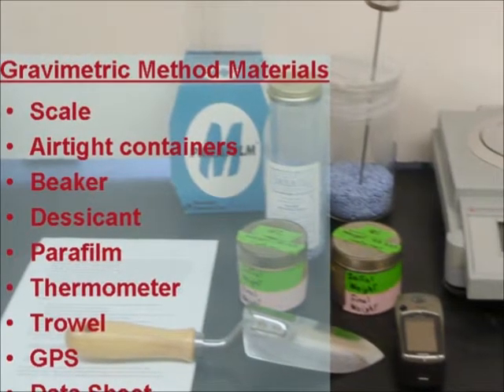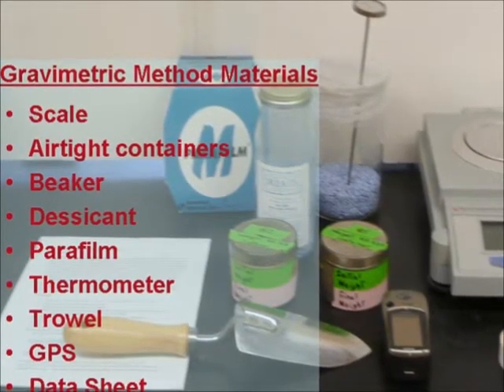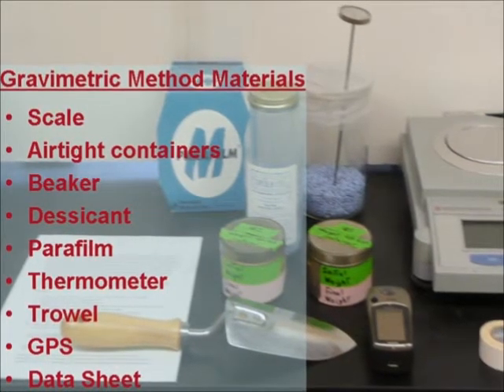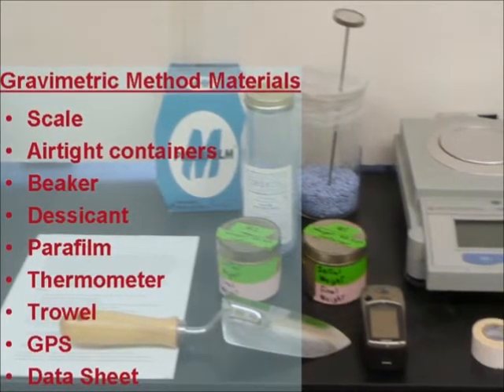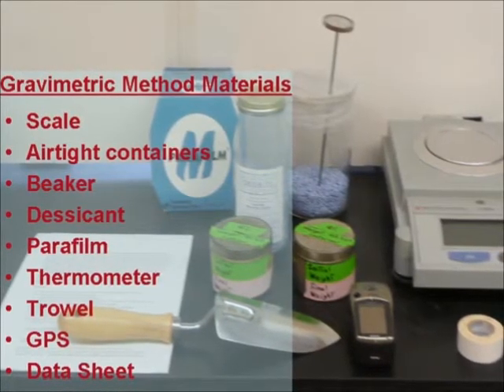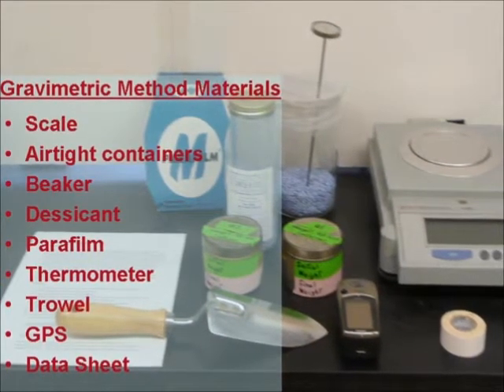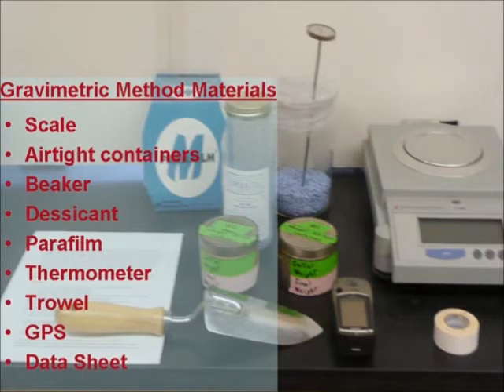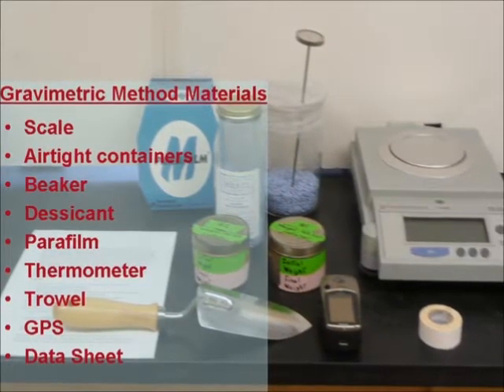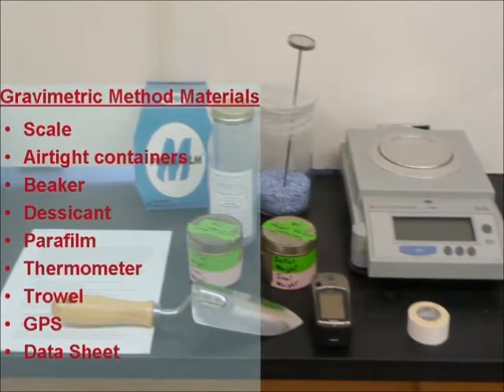The gravimetric method typically requires seven basic items: a scale, airtight containers for the soil samples, a trowel, tape, a GPS, data sheets, and a desiccator. The desiccator can be created in any basic laboratory with a large beaker, desiccant, parafilm, and a thermometer. This list can be supplemented or changed upon a greater familiarity with the gravimetric method.